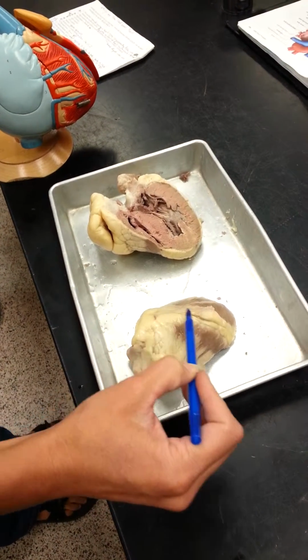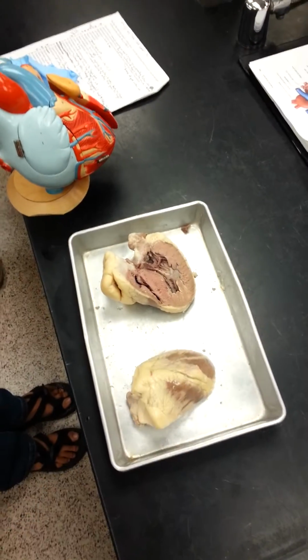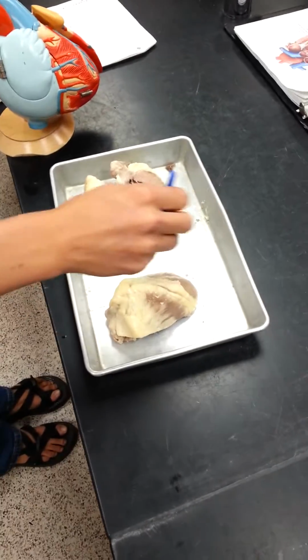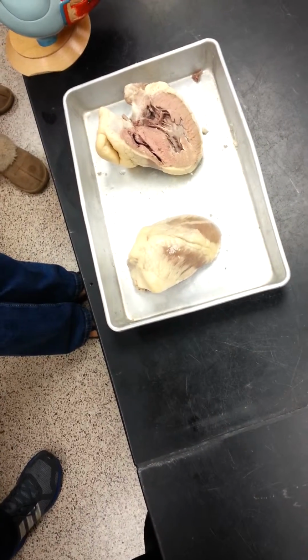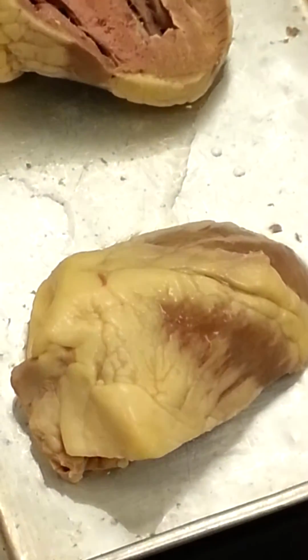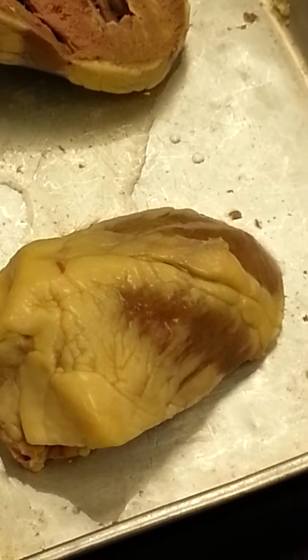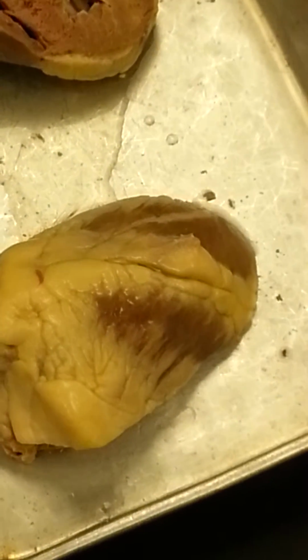It actually is this kind of ridge that runs down the front side of the heart. And one side looks bigger also, since this sulcus is telling you where left and right is. Does that make sense? Anterior interventricular sulcus. So I could point it out on the sheep also. I think it's actually easier seen on the sheep heart than the models.